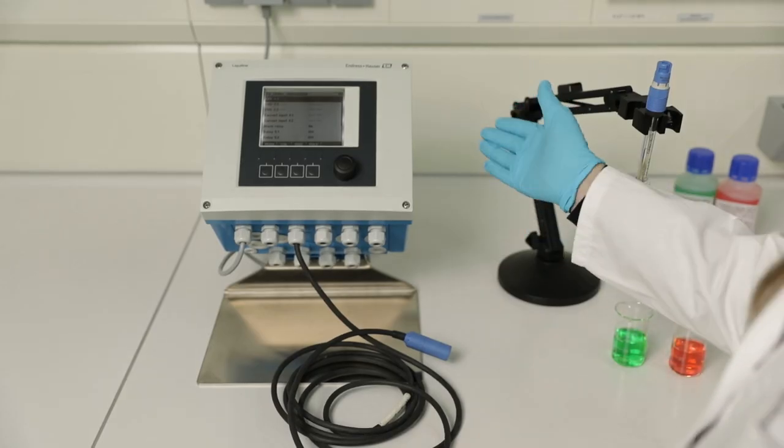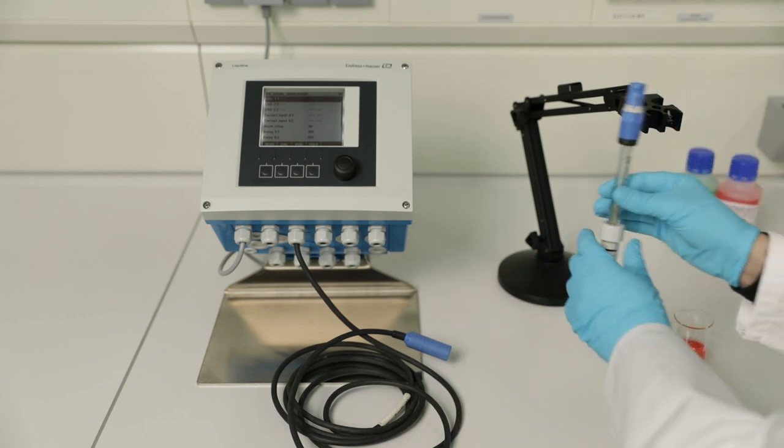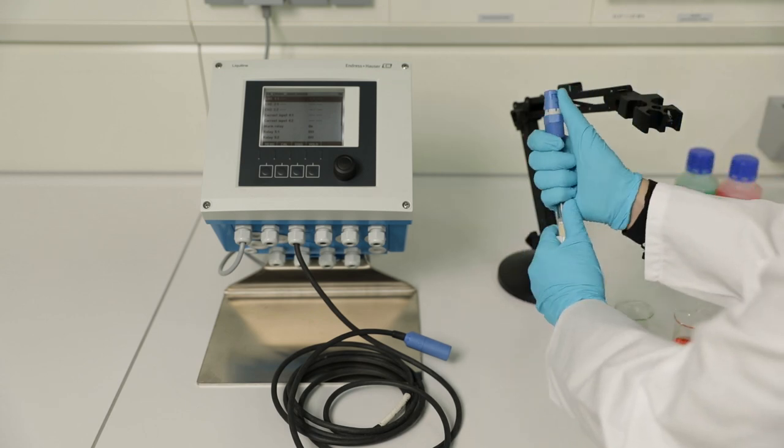Use an instrument with Memosense technology and Memosense cable like the Liquiline CM44, connect the sensor, and open the calibration menu.